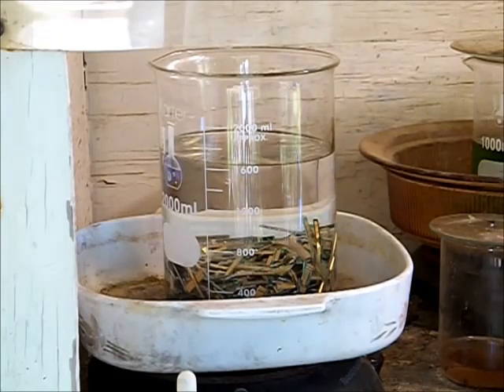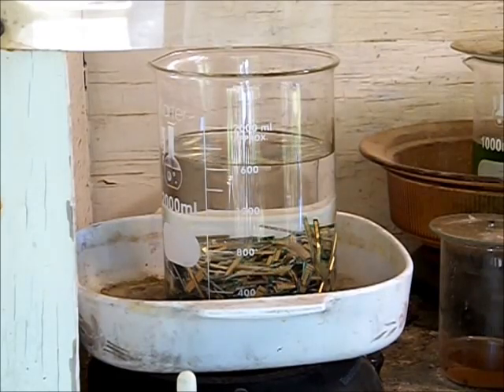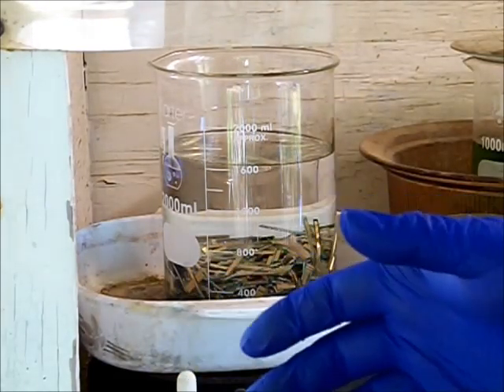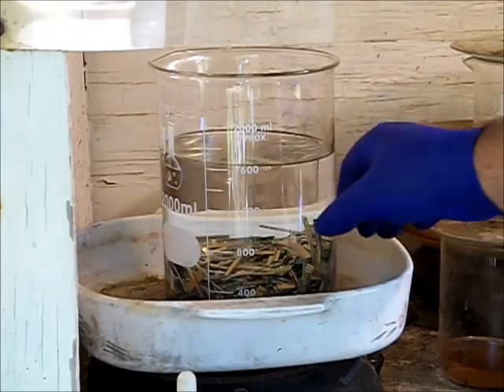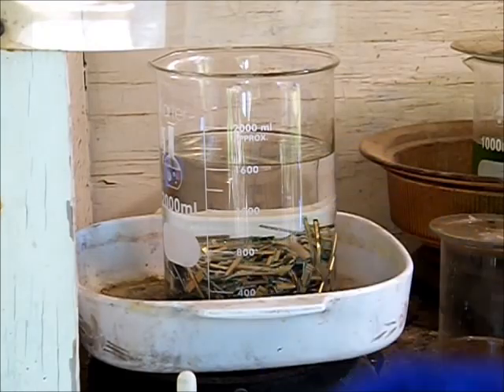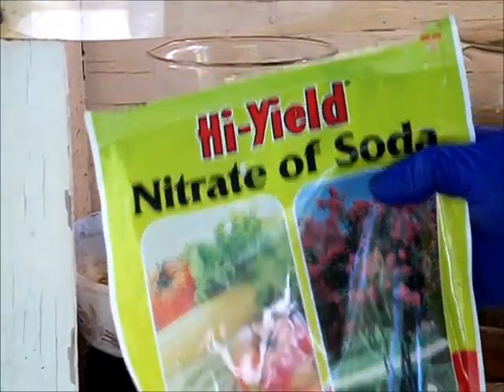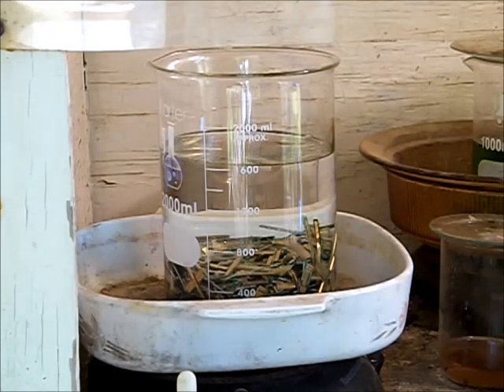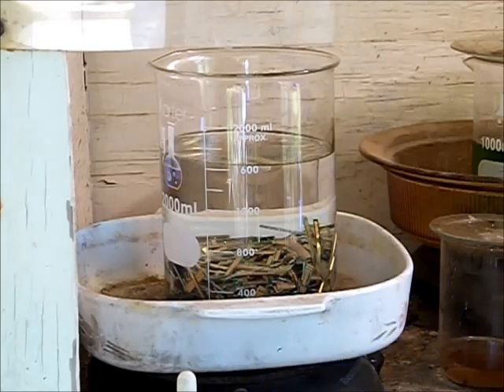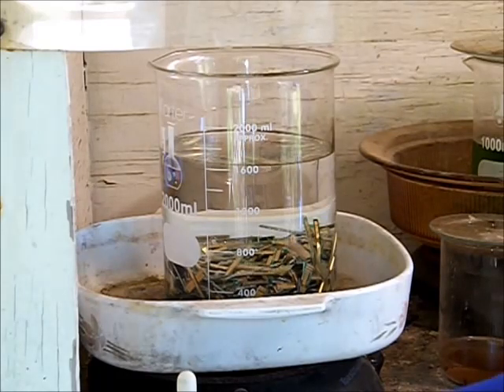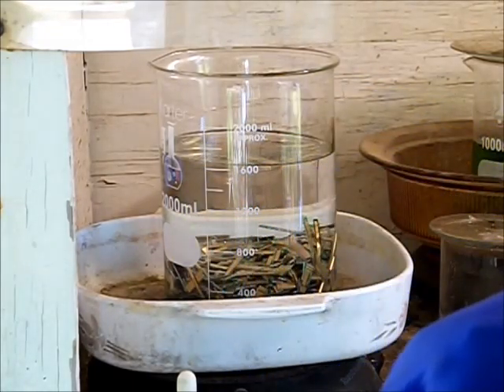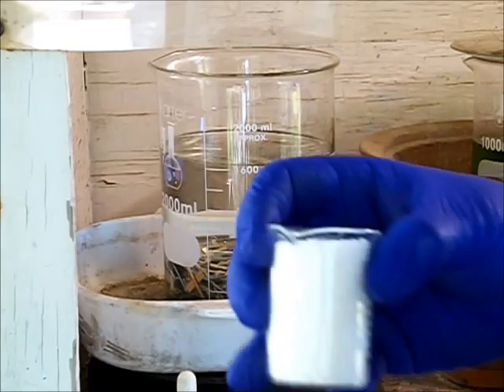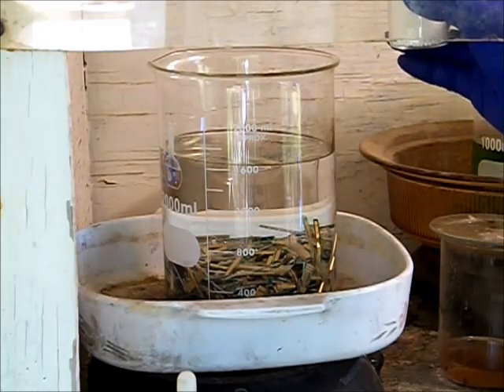At this point you can go ahead and add your nitrate because it's not going to react until it gets hot. We've got our nitrate of soda. I've got a small beaker I use for a scoop. Just go ahead and add that nitrate in there.